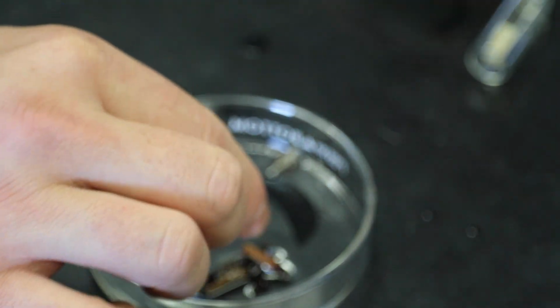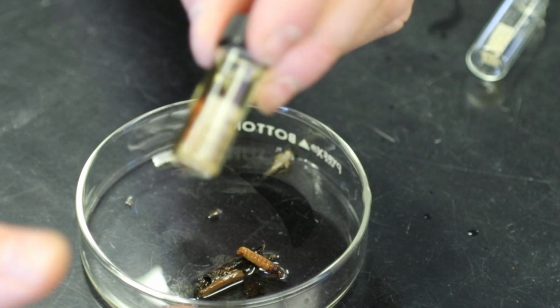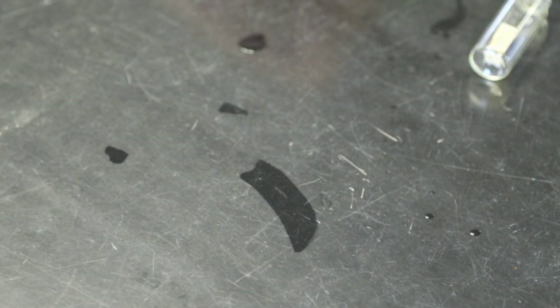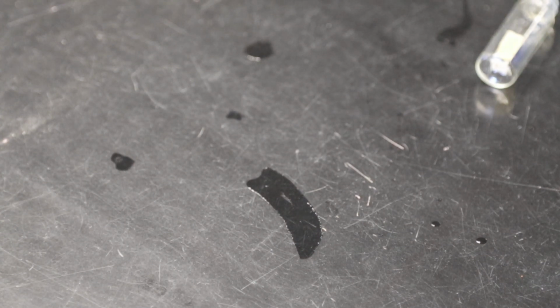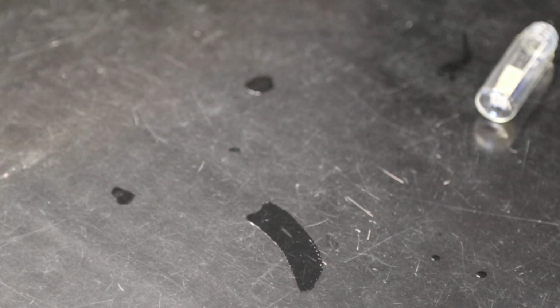Alright, so I've got another caddisfly here. It's the same thing, so there's really no use of showing you multiples on this one. So we'll put those up in a minute. Up next, we need a dipteran. A dipteran are your true flies. So I'll need that horsefly. I'll just take this box. Tell you what, we'll come back to Diptera.